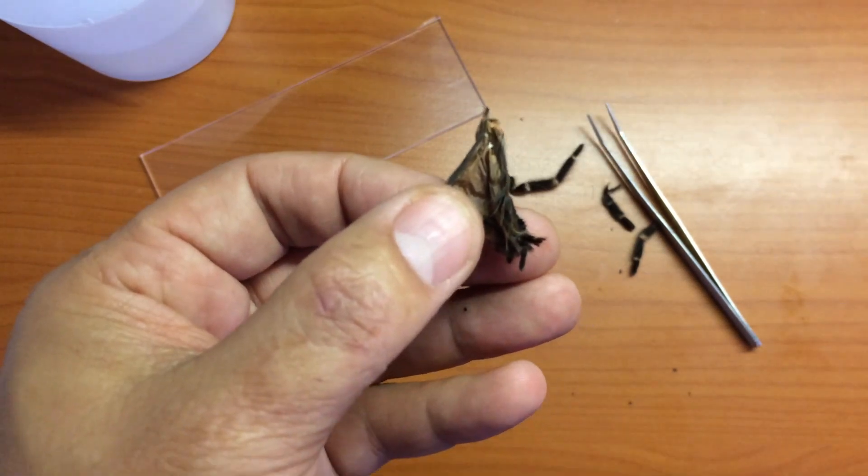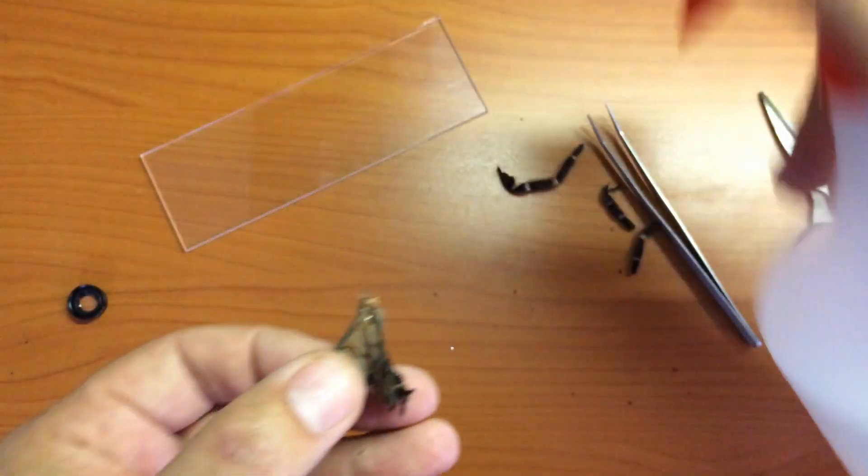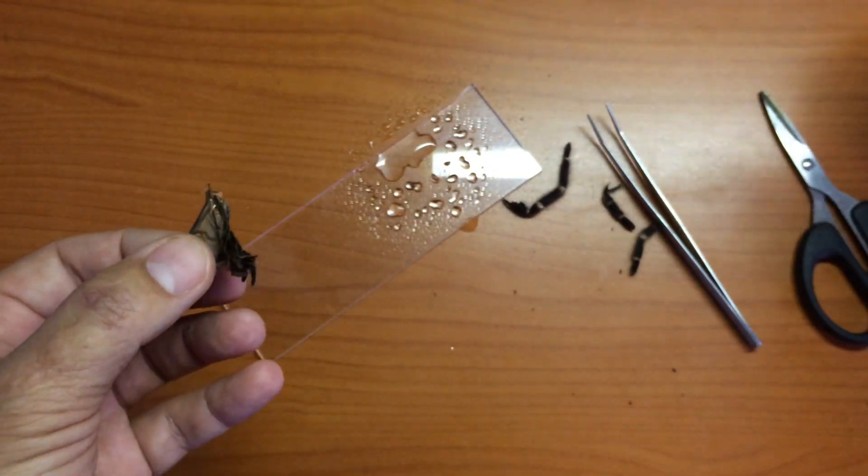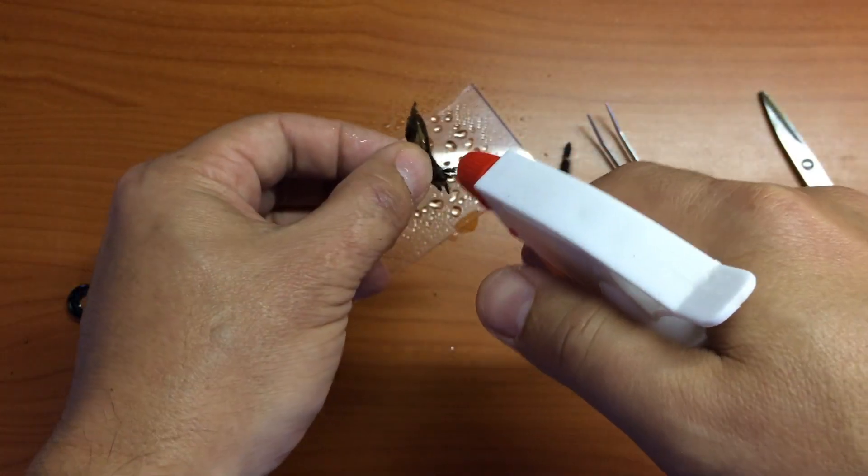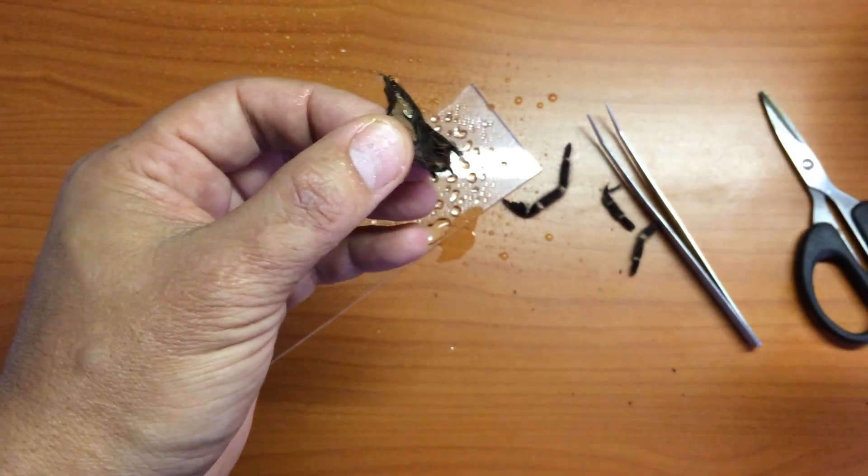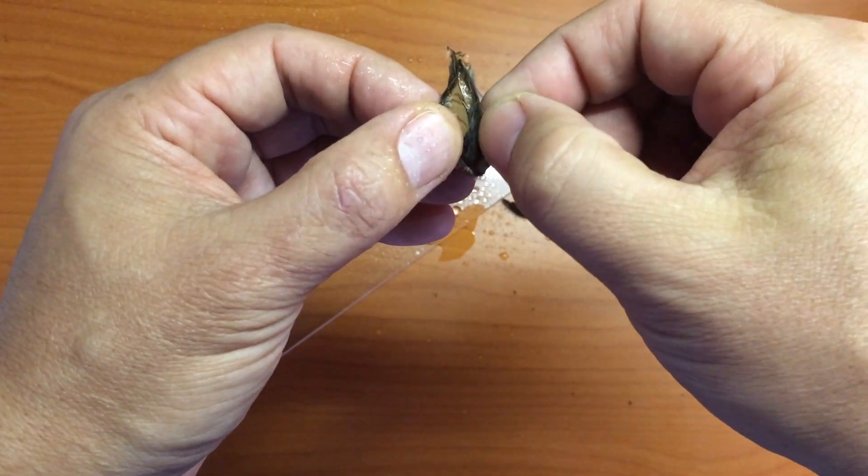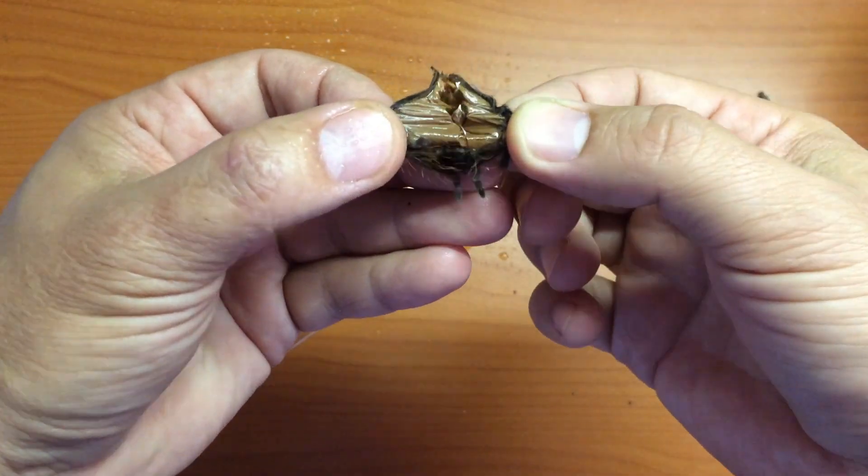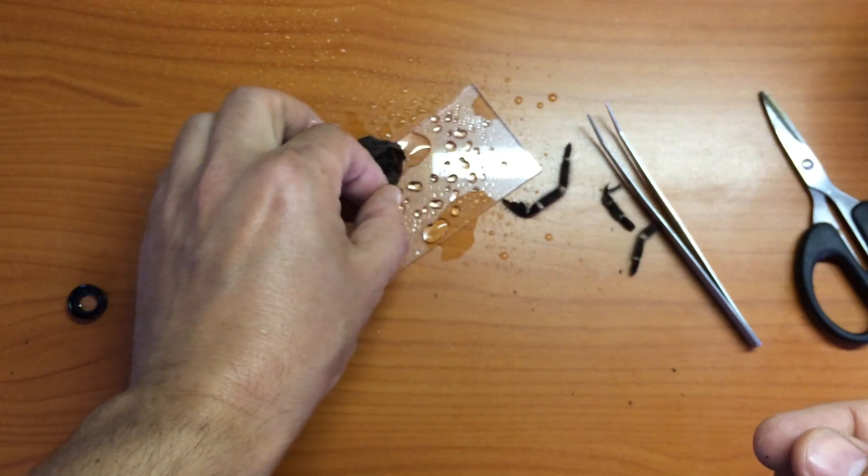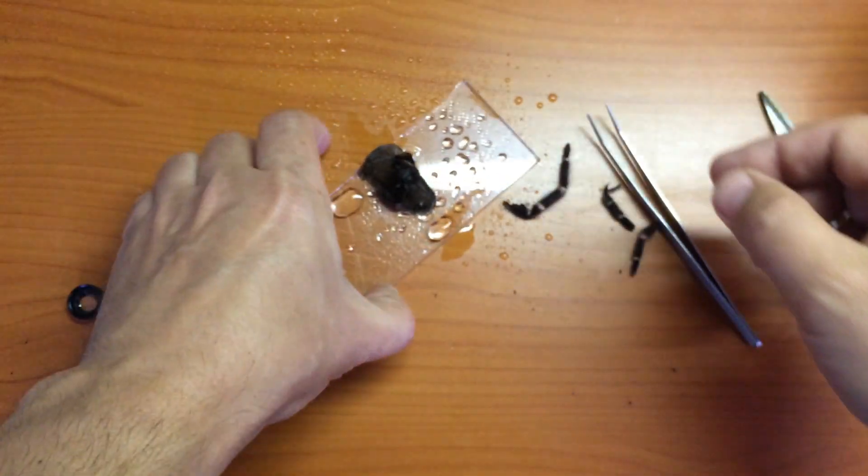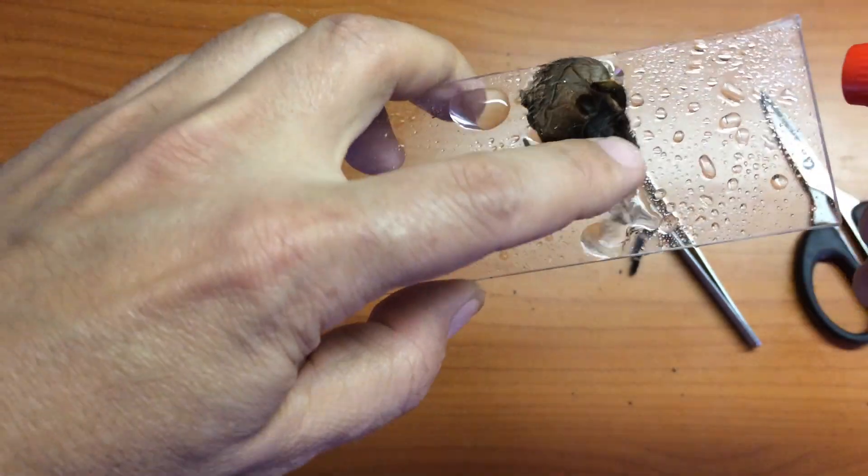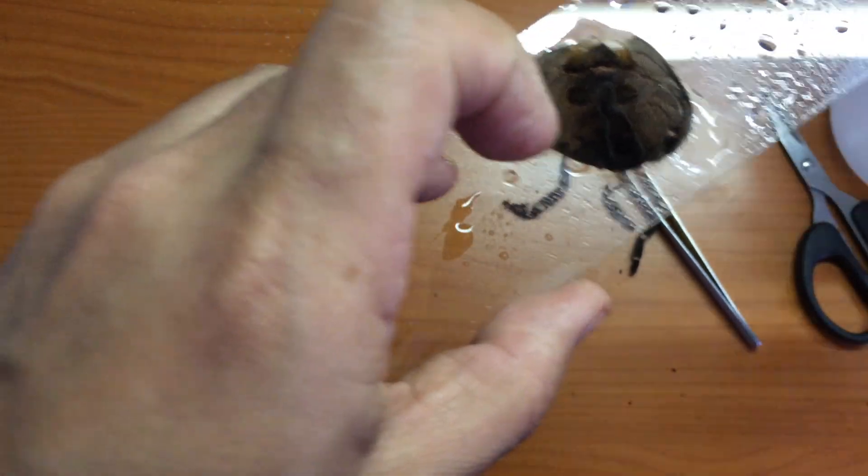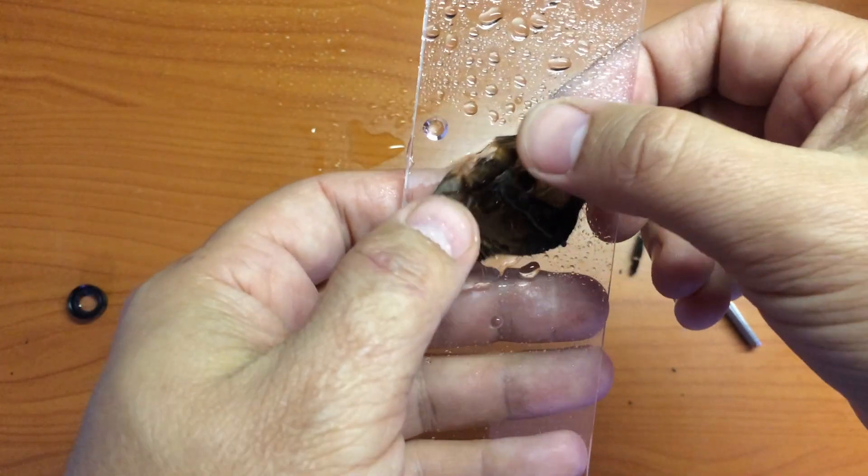I'm just going to take my spray bottle, make sure it's working, put a little bit of spray on this piece of perspex, wet this a little bit as well. It tends to work like a parachute once it gets wet, that absorbs water very quickly and it'll start to open even more. So when you plunk it on a drop of water, you'll see that it'll just start to spread open on its own. See, it's just opening by itself, which is great. It makes it a lot easier to work with.